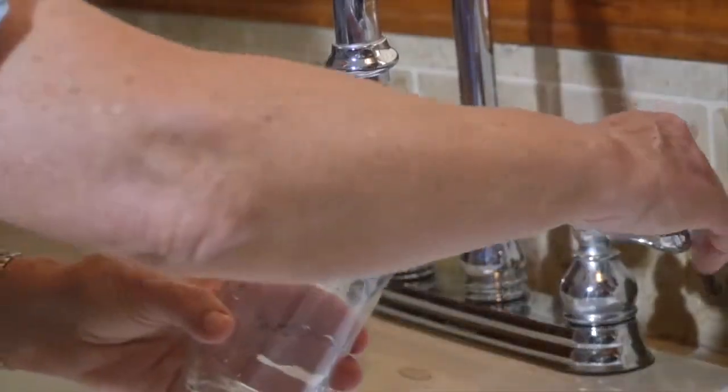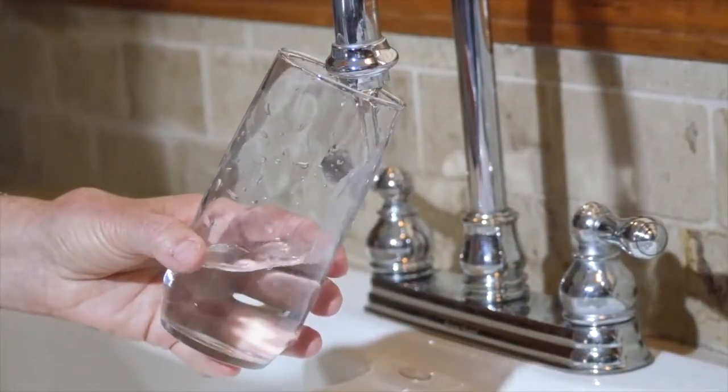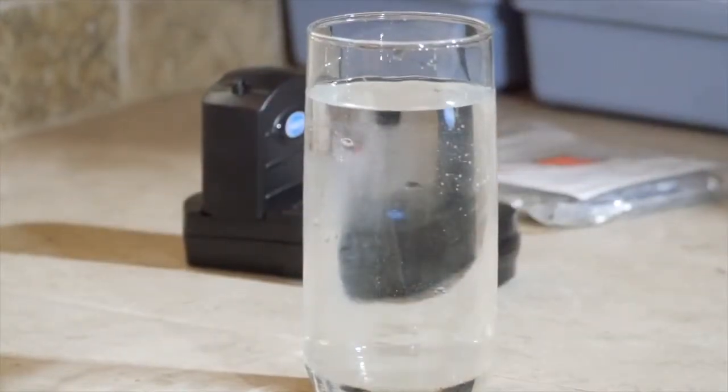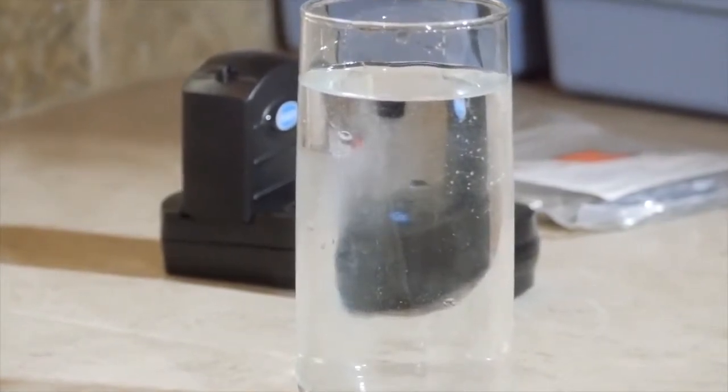In this video, we're going to discuss how to take a good chlorine sample, plus methods for analysis. Effective measurement of chlorine residual is essential for protection of public health. The presence of the residual not only provides disinfection, it also serves as an indicator of water quality. Loss of a residual can be an indicator of a water quality problem.